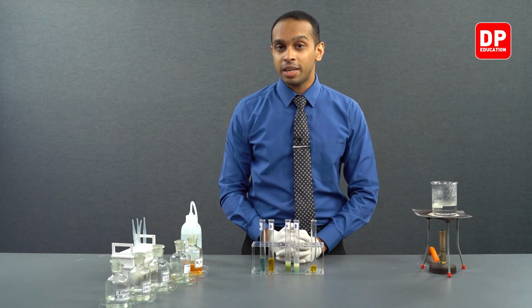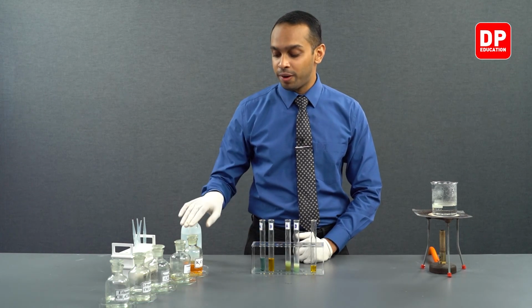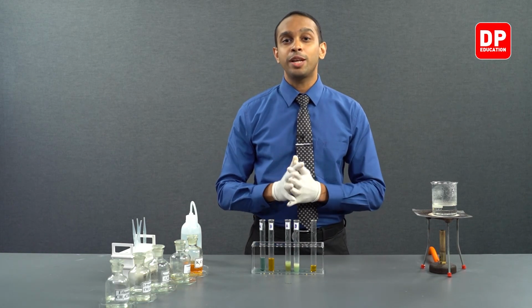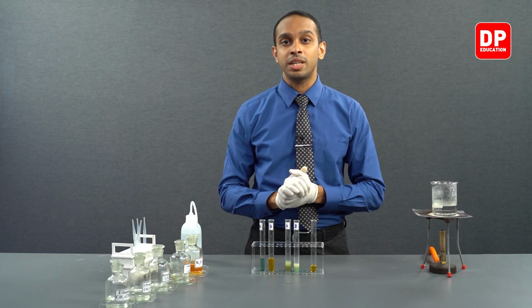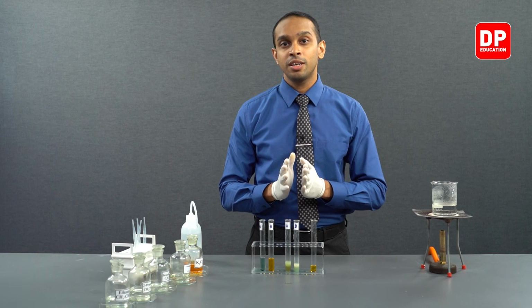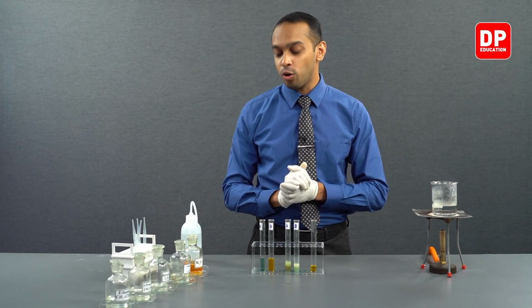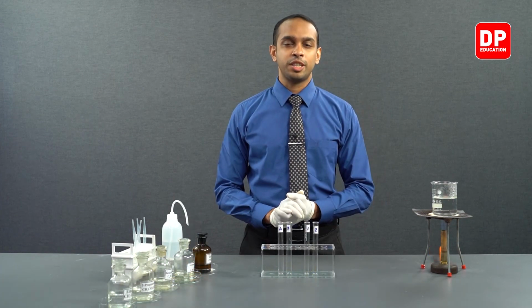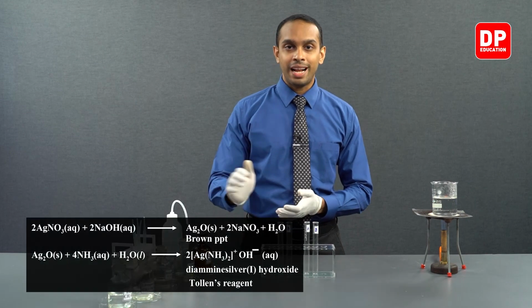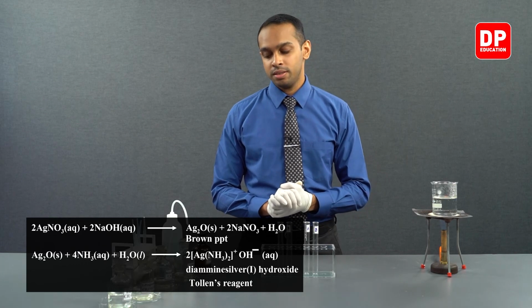With that, we come to an end of the reactions that you see with acidified potassium dichromate with aldehydes and ketones. Now, we plan to move on to our next test, which is the reactions that you see with Tollens reagent. So aldehydes and ketones, how they react with the Tollens reagent can now be tested. In this section of our practical, we will focus on how these aldehydes and ketones react with the Tollens reagent.